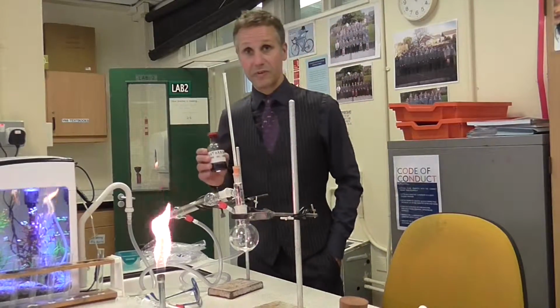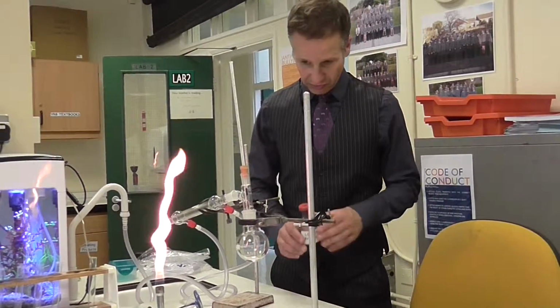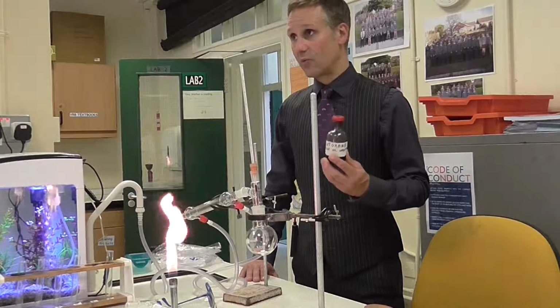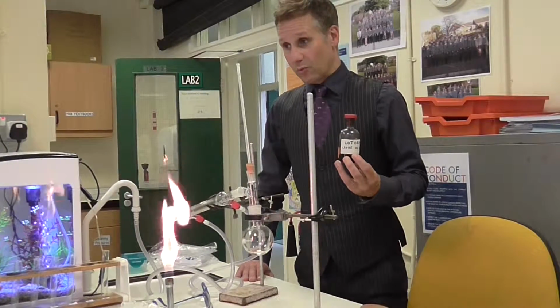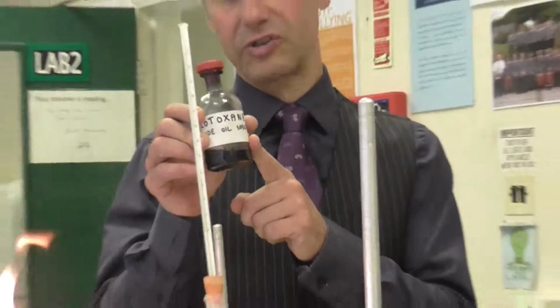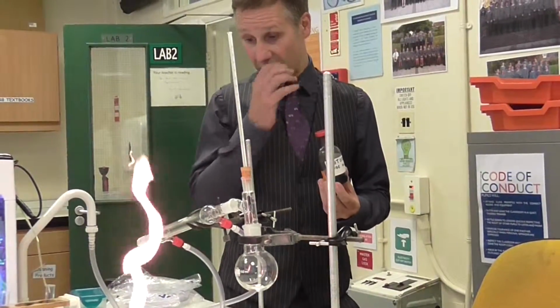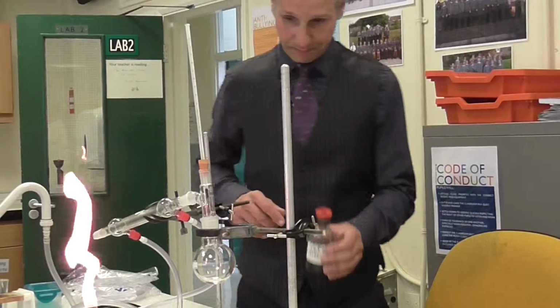So this is a demonstration on fractional distillation aimed at Key Stage 4 chemistry. It applies to both double and triple exams, and it shows you how we refine crude oil to make useful products. One of the problems is that we can't really demonstrate this in class anymore, because even in this slightly less dangerous version there are still carcinogenic chemicals that cause cancer, so we're not really permitted to light these in front of you, so we're doing it as a video demonstration for that specific reason.